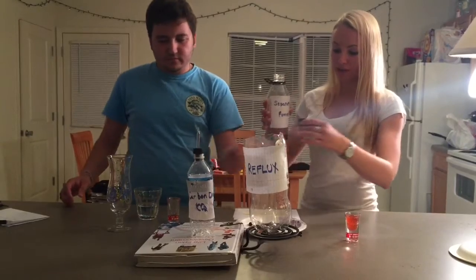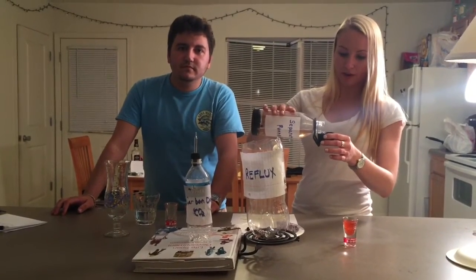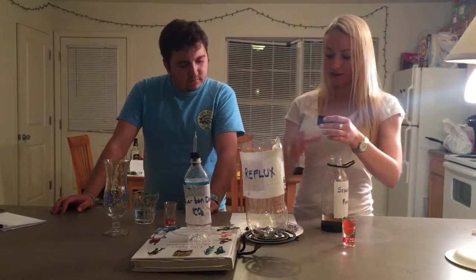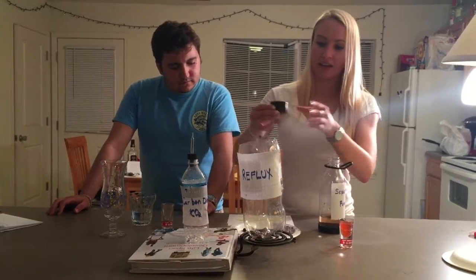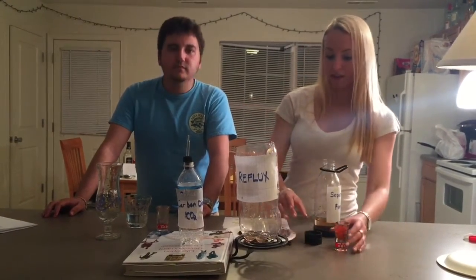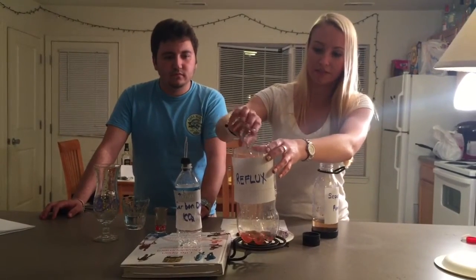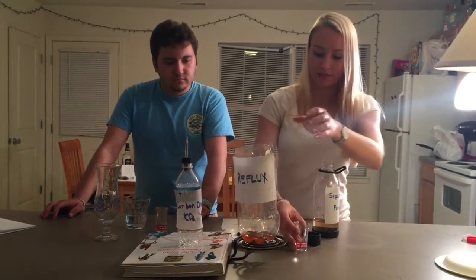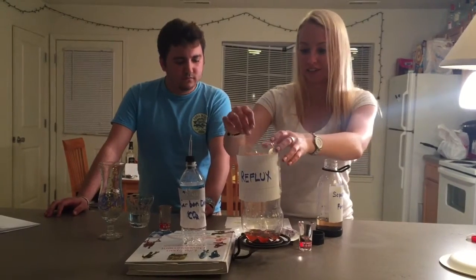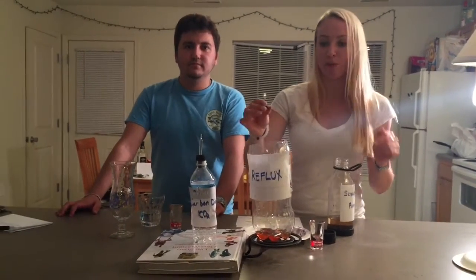Next, you take a 0.25 milliliter sample of the alkyl chloride product formed and convert it to a Grignard reagent by heating it in a reflux. You do this by adding THF, oven-dried magnesium turnings, and a small amount of 1,2-dibromoethane.